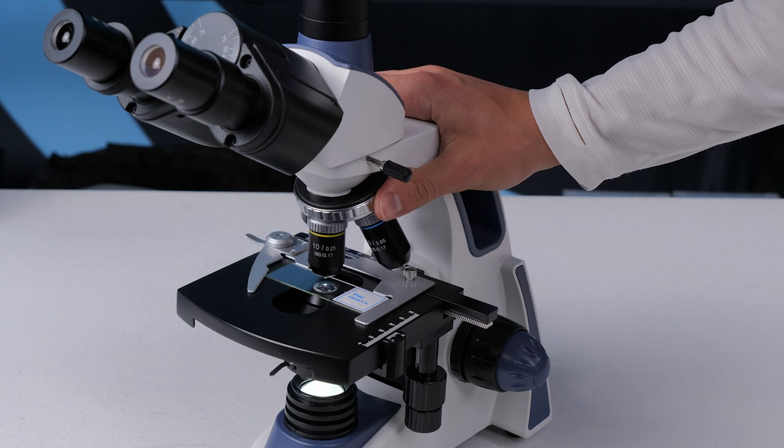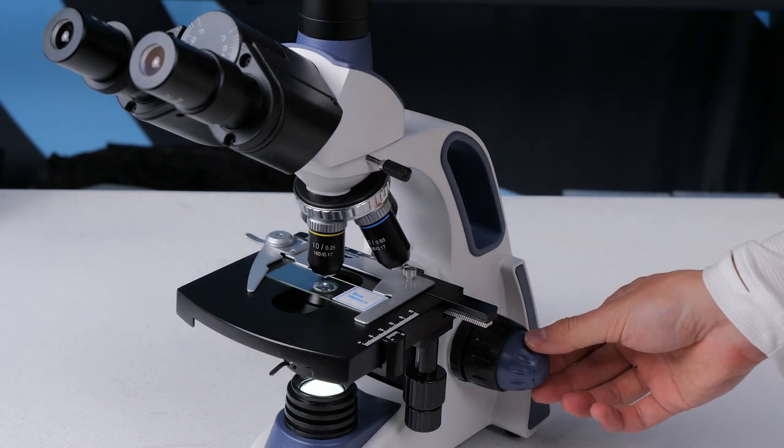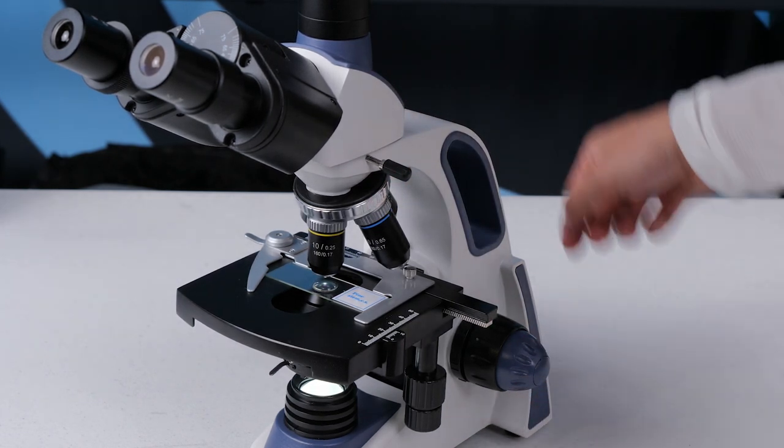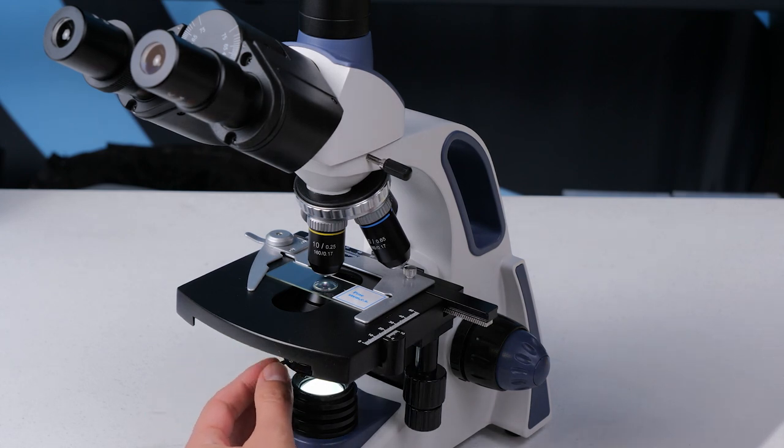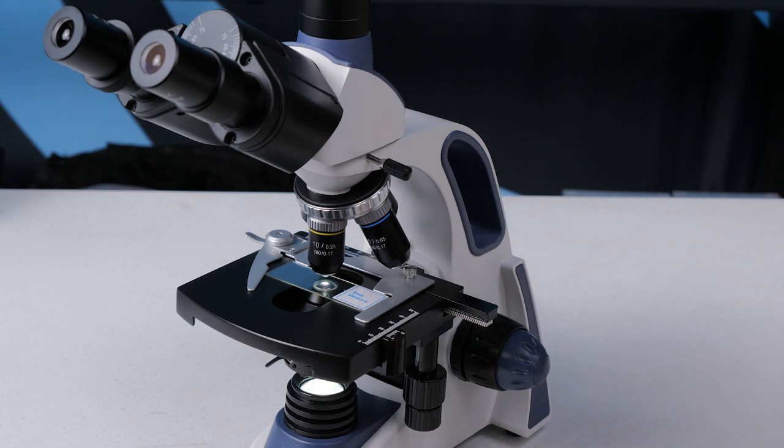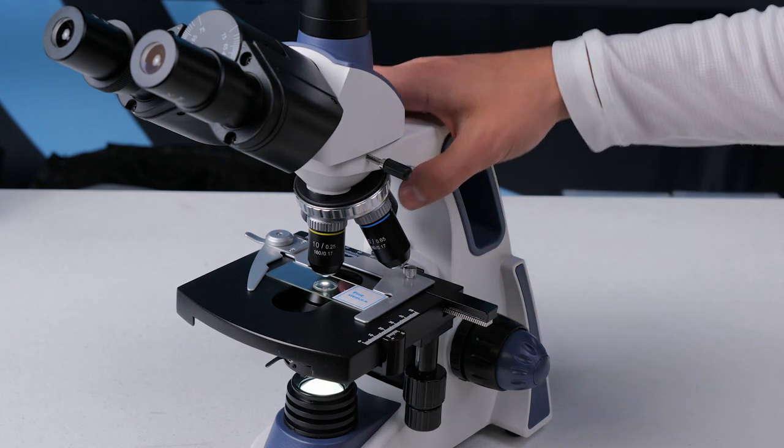Okay let's move up to a higher magnification. You can rotate down the 10x objective. You'll have to readjust the focus, the condenser iris, and the brightness. Unfortunately you basically have to do this every time that you use a different objective, whether you're using the horizons microscope or any other microscope.